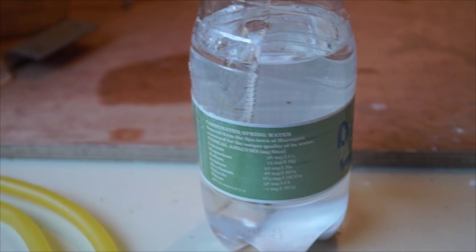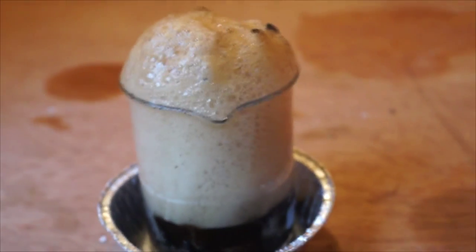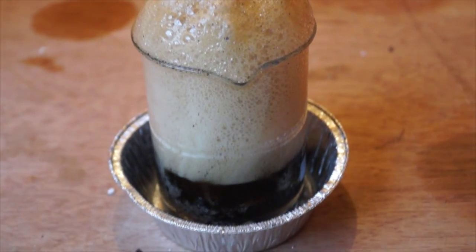When the reaction was complete, I made a solution of sodium hydrogen carbonate and washed my pipette and the reaction beaker in order to neutralize leftover acid from the demonstration.